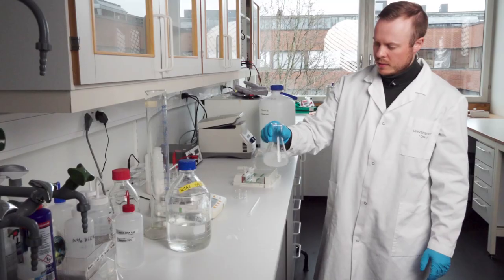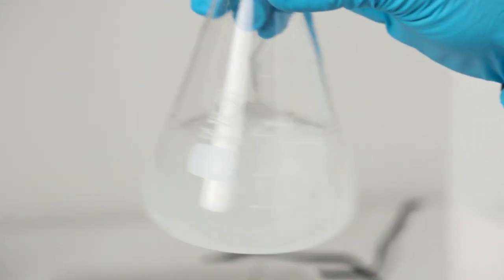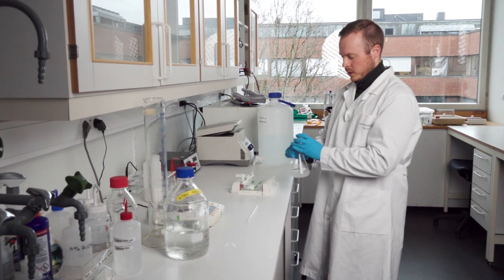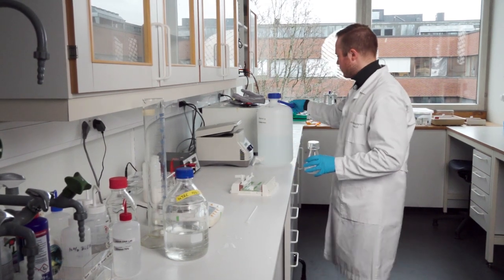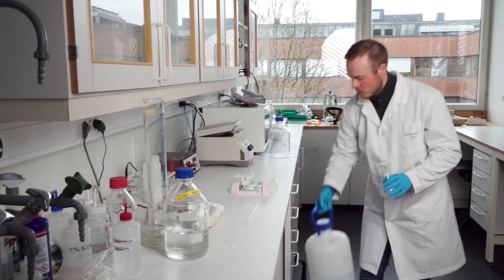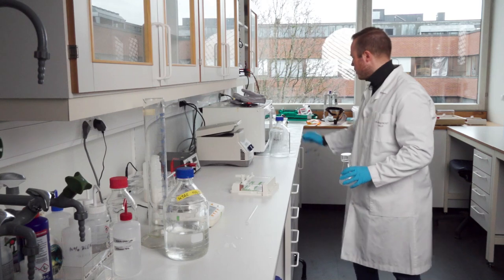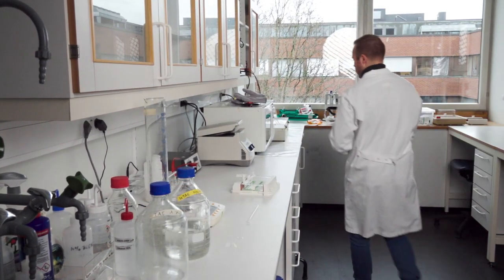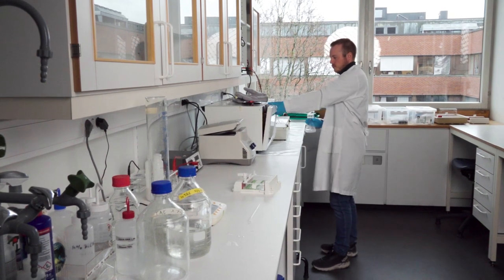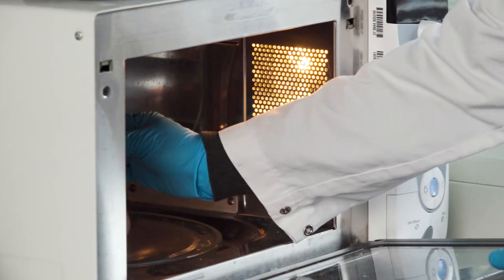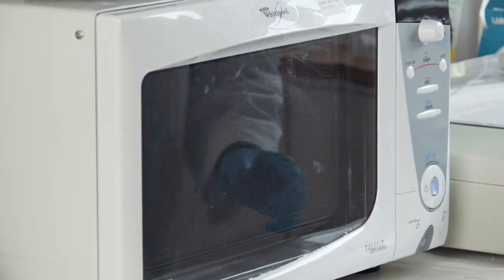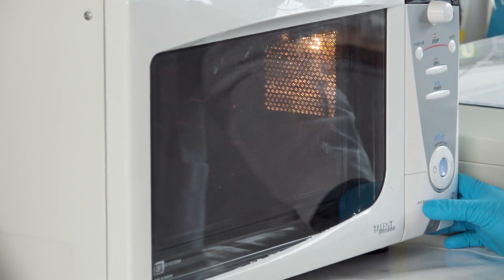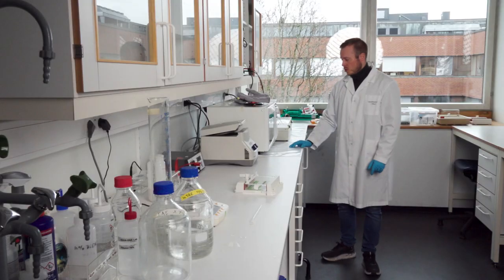I gently shake the flask to spread the powder around in the solution, put on the cap, and move to the microwave. I open the microwave, put the flask in, and push jet start. I start with one minute.